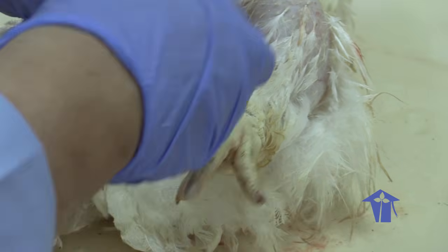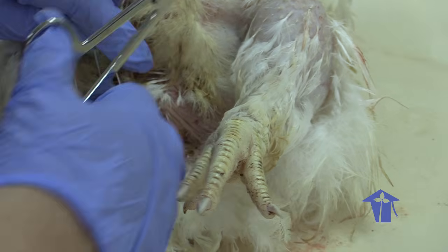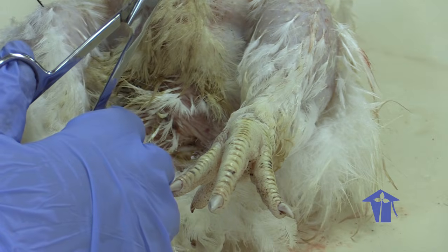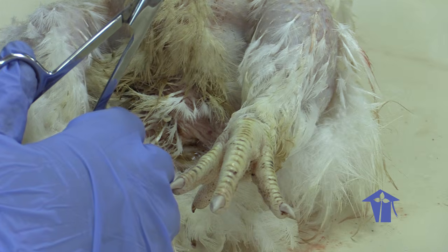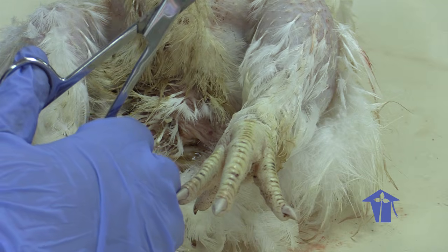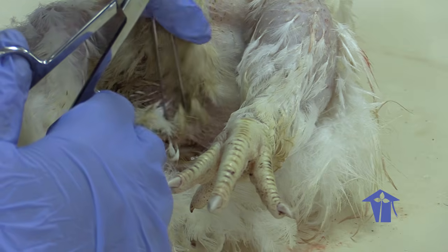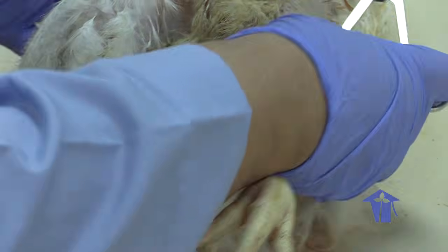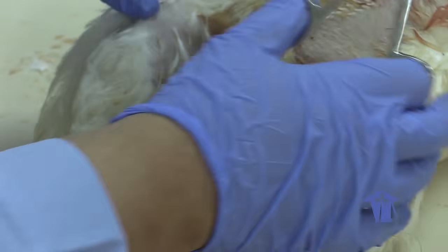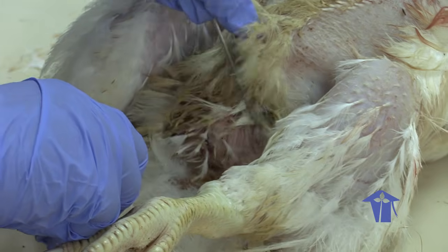But like I said, this guy here was not bred for breeding purposes. This is a, what do you call him again? This is one of the chickens. Broiler. A broiler, yes, thank you. I forgot the word for broiler. This is a broiler, so it is basically all about just packing on pounds to be eaten by a hungry family.